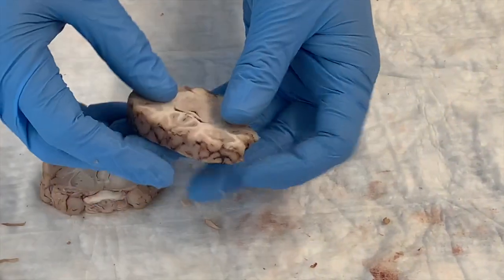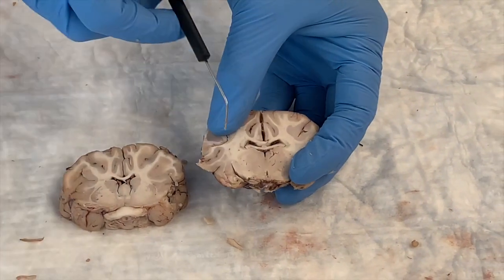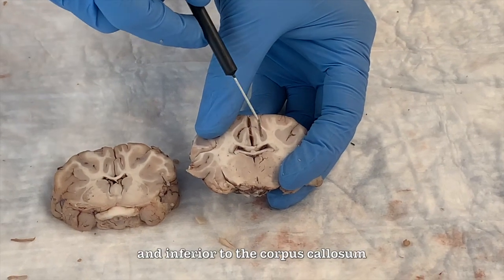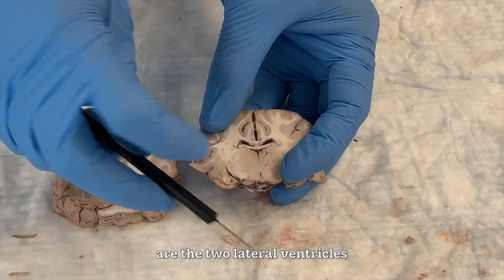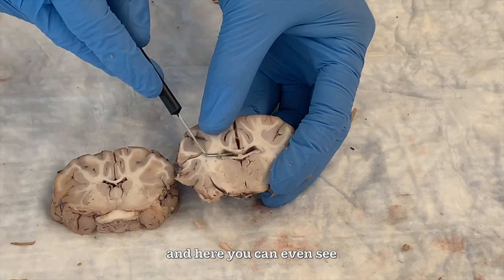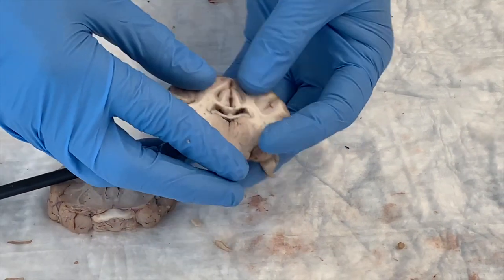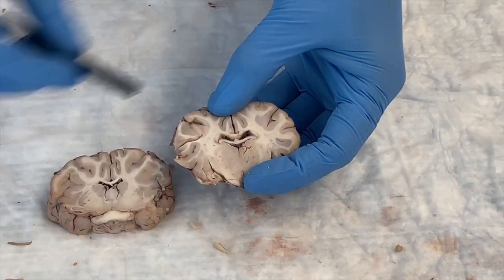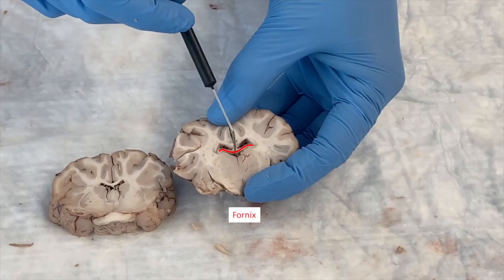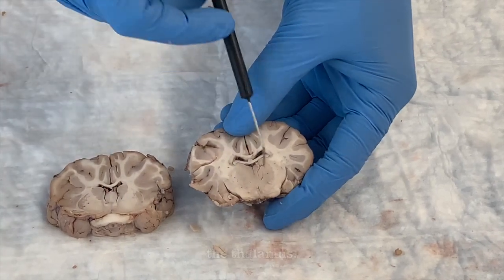more posterior, you will see the corpus callosum here, and inferior to the corpus callosum are the two lateral ventricles, and here you can even see the choroid plexus present in these lateral ventricles. Now what is inferior to the lateral ventricles is the fornix right here. This is the fornix. And here you notice the thalamus.